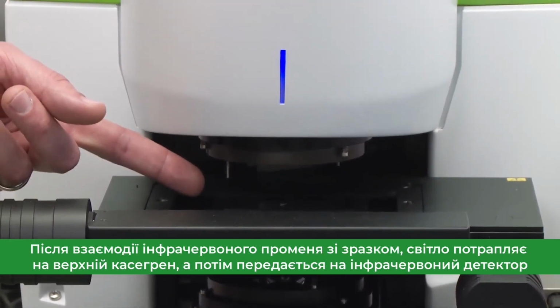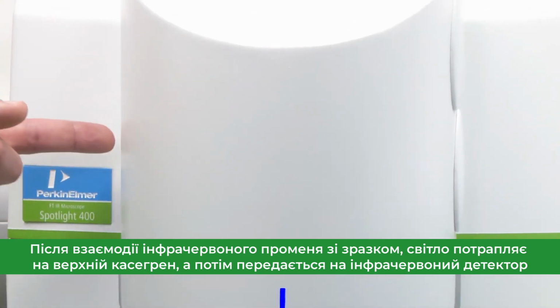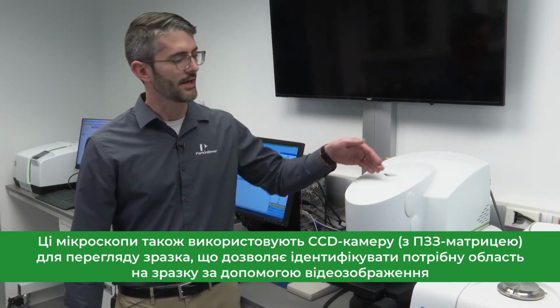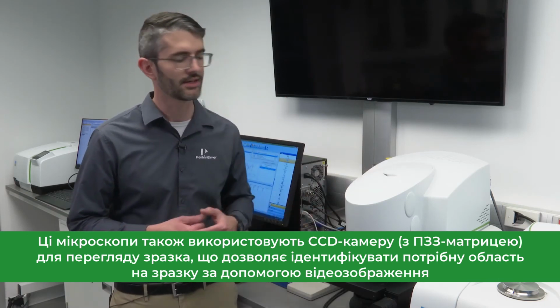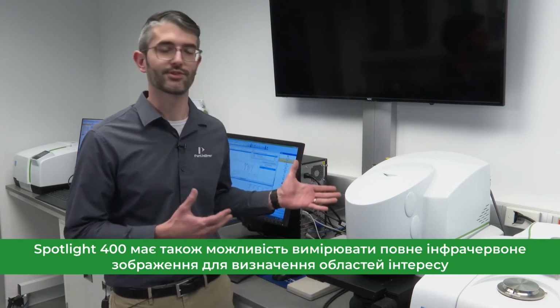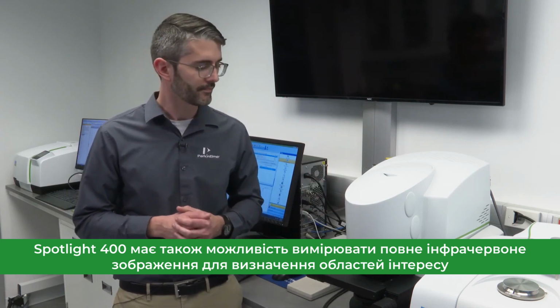Once the infrared light has interacted with the sample, the light goes to the upper objective and is then passed to the infrared detector. These microscopes also employ a CCD camera, which is able to view the sample. This allows you to identify a region of interest on a sample using visible features, as well as with the Spotlight 400, having the ability to measure a full infrared image to identify regions of interest.